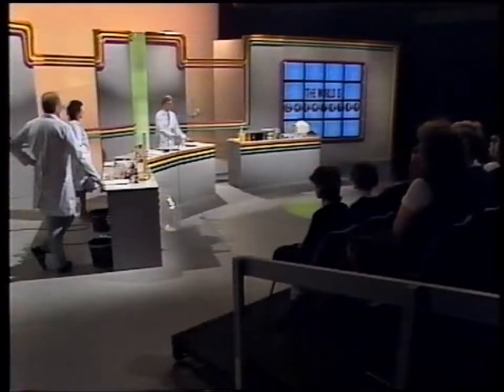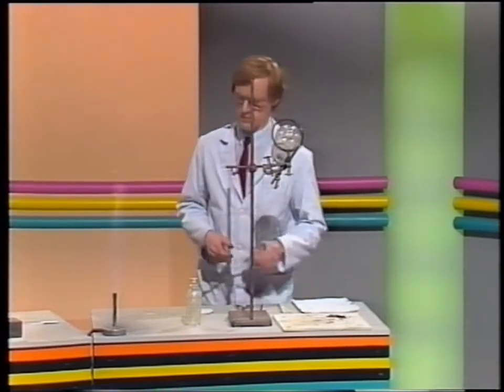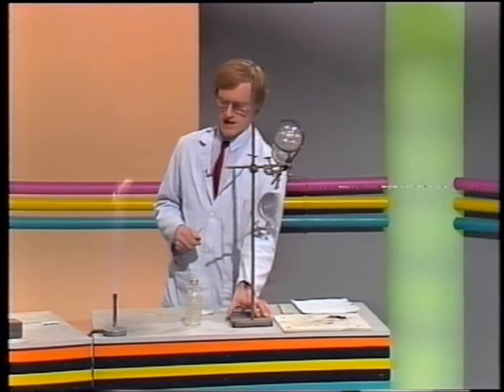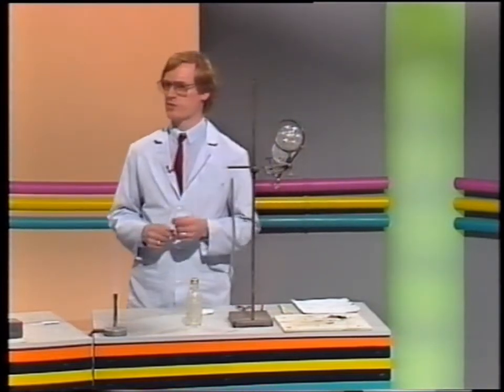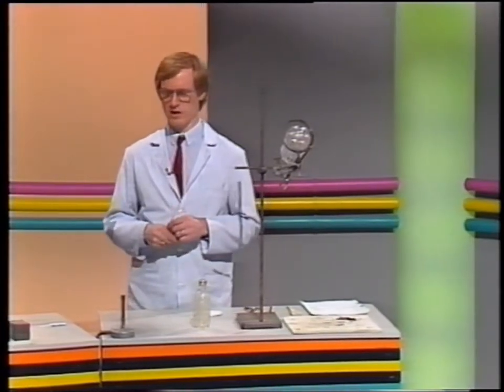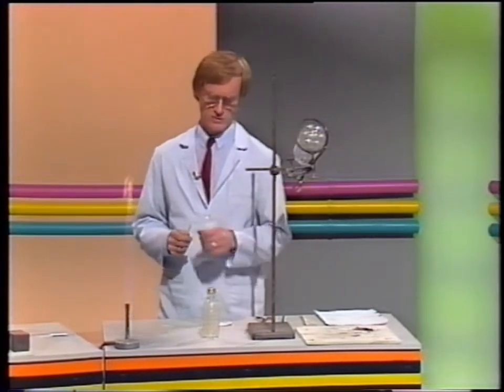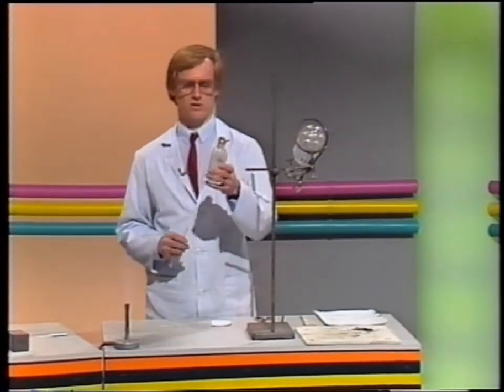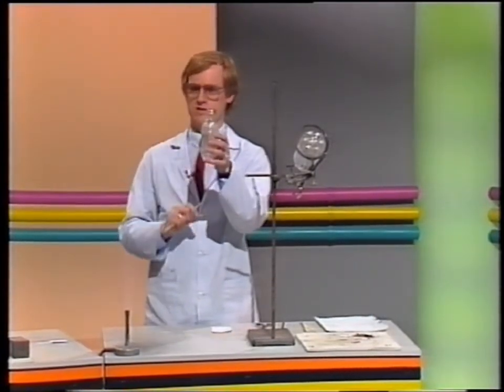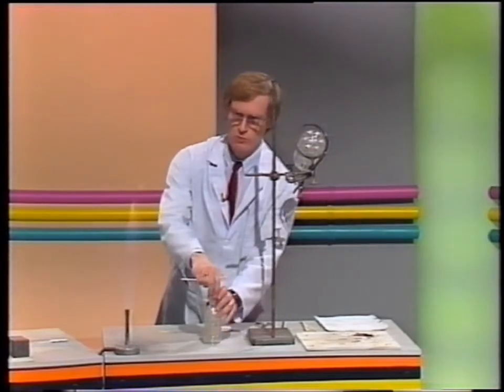Now, as Anne's shown you, gases, when they react, can combine very, very vigorously and give rise to explosions. Luckily, we don't come across hydrogen in everyday life, so it's not really a hazard. But the natural gas that's pumped into your homes is a hazard, as I'm sure you're aware. Normally, you see it burning in a relatively controlled fashion, rather like the Bunsen burner here, but it can explode given the right conditions. In the bottle here, to give you some idea of the proportions, I've got so much natural gas and the rest is oxygen. And I'm going to show you what happens when it burns.